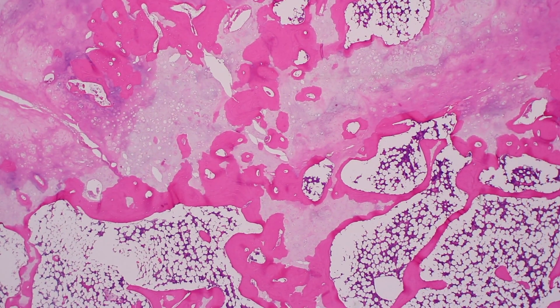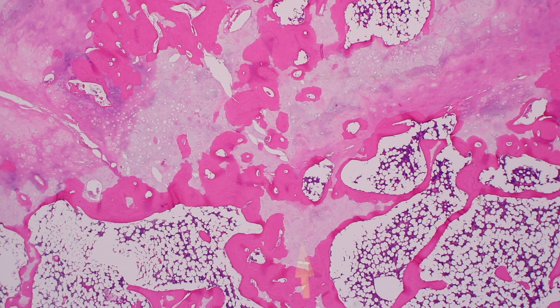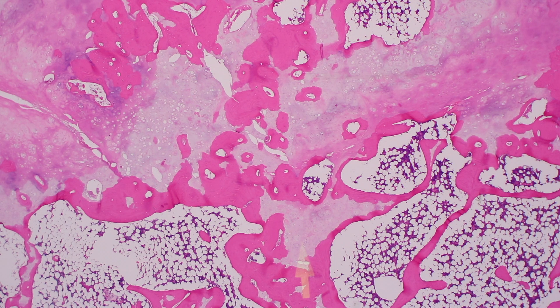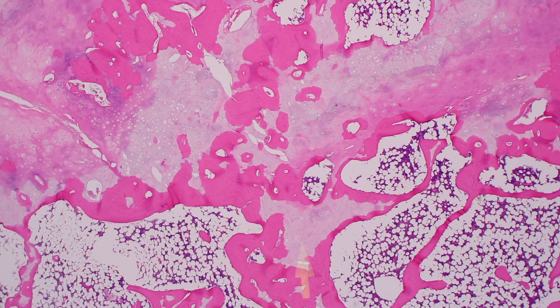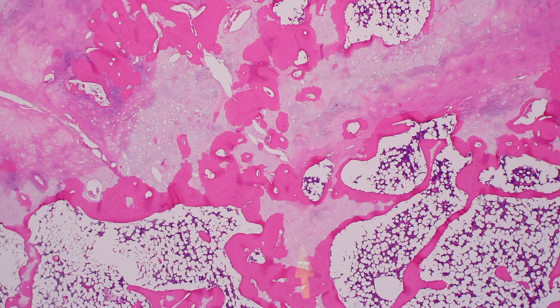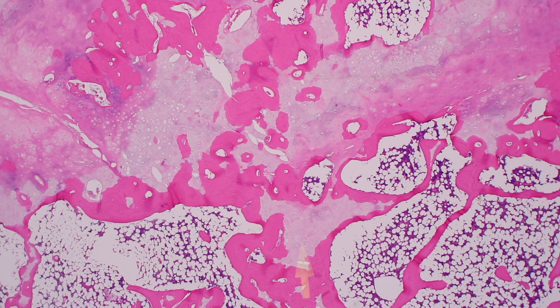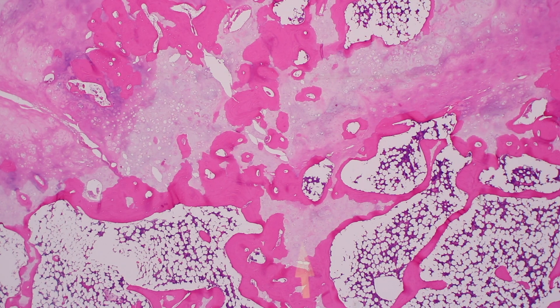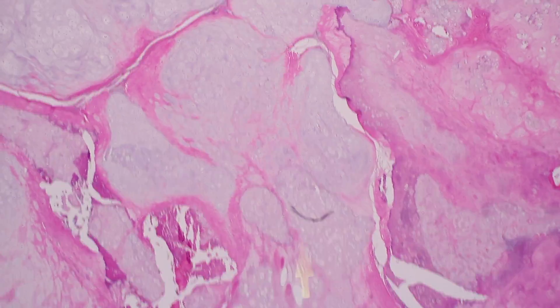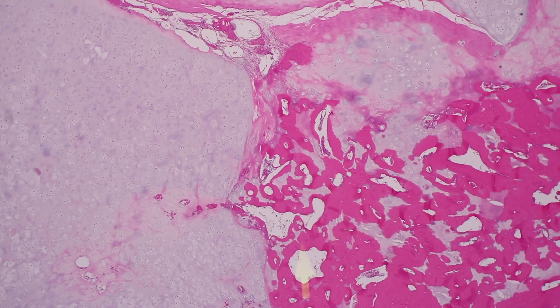All of this represents evidence where you have cartilage in the middle of bone. Sometimes people confuse this with infiltration. Cartilage in the middle of bone means that surface has acted as a surface for the deposition of bone on it, and portions of it have undergone enchondral ossification. We now have these large coalescing nodules of cartilage.